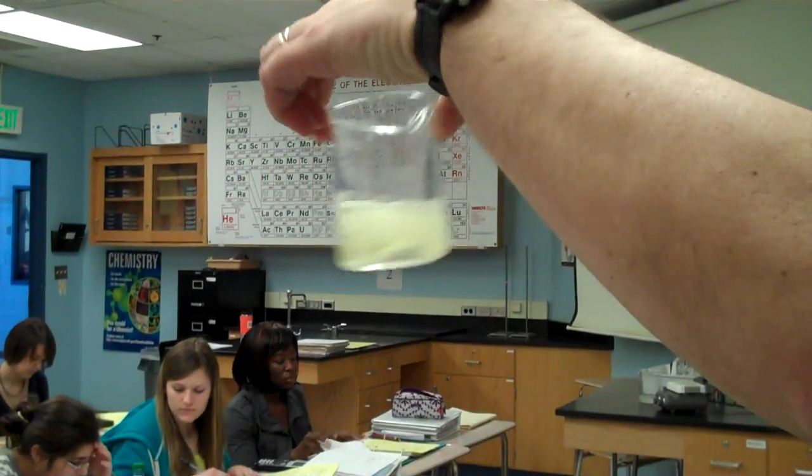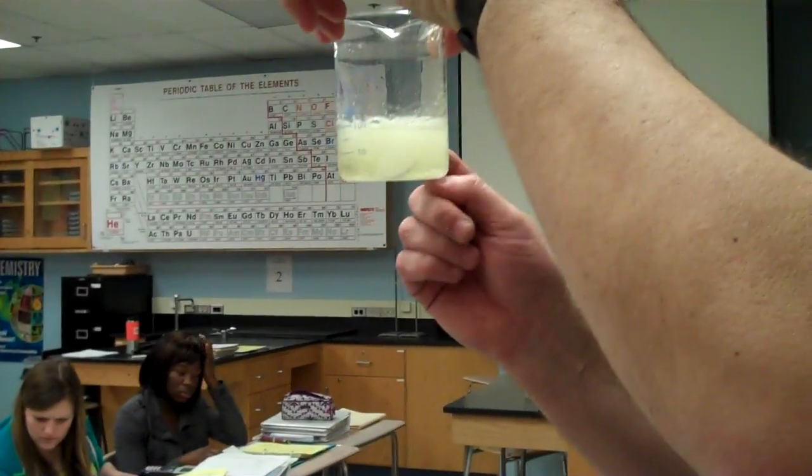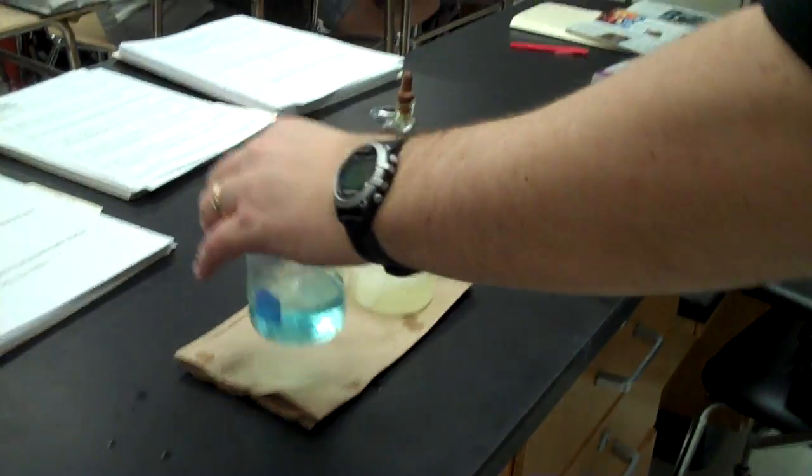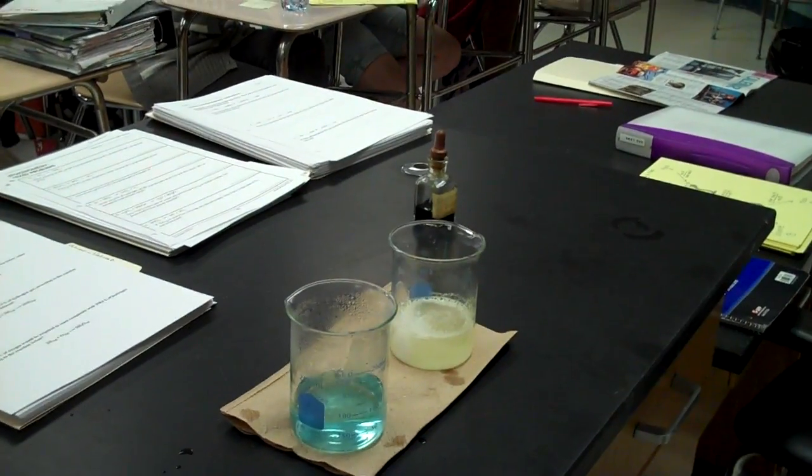a nice yellow, pale yellow at that. So lots of CO2 in here, no CO2 in here. Okay, can I stop this? You can stop.